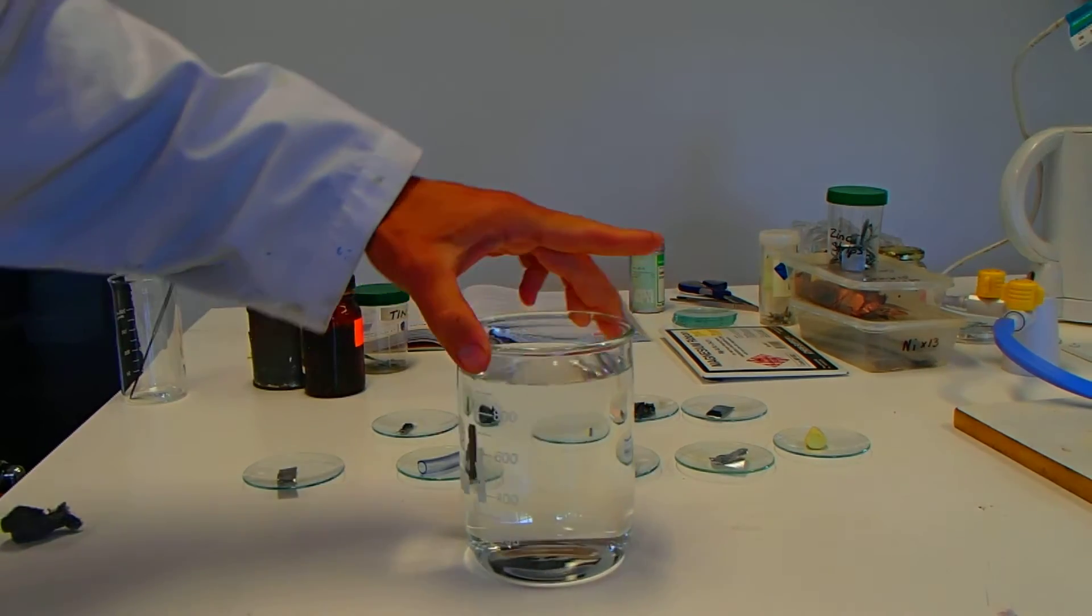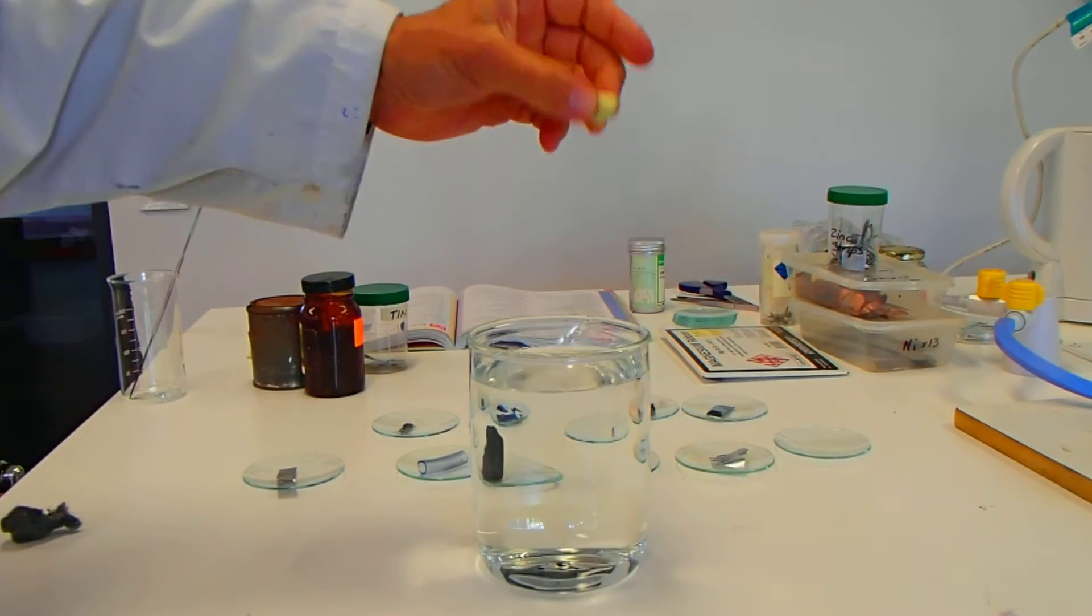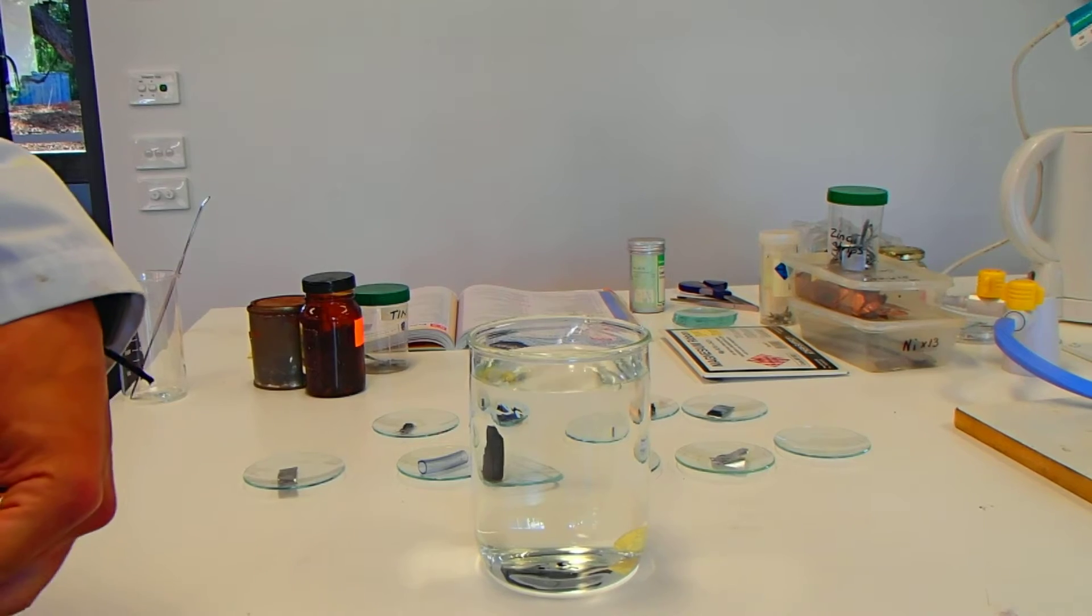We've got this beaker of water here. I'm going to see if these samples sink or float. So we have our sample of sulfur. Let's pop it in. No, straight to the bottom. So we'll leave that there.